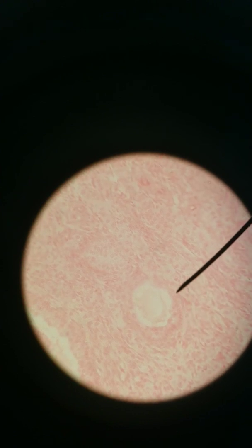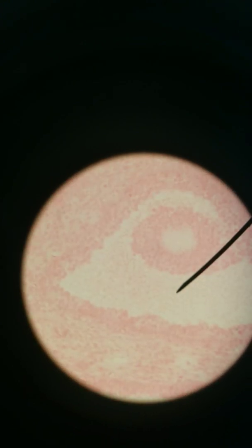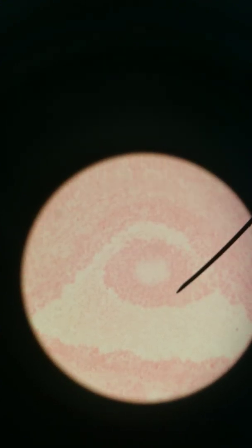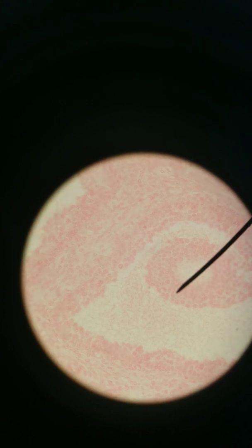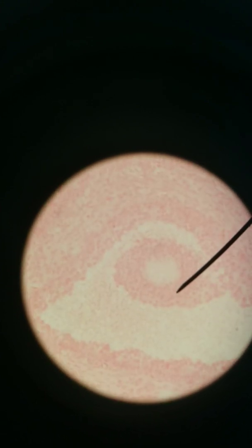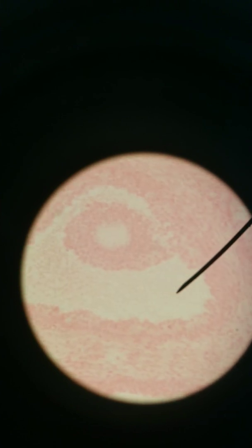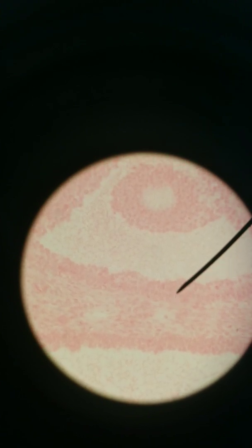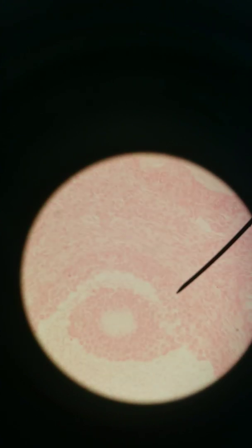Theca cells produce progesterone, which is important for sustaining a pregnancy. Moving to a tertiary follicle — you can see the oocyte here. Obviously the follicle is much, much bigger. The cells surrounding the oocyte are called the corona radiata. Here's the antrum — much, much bigger antrum. Granulosa cells from here to here producing estradiol, and then outside of that you have theca cells, a little bit flatter, surrounding the follicle.